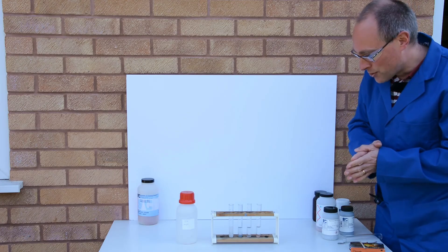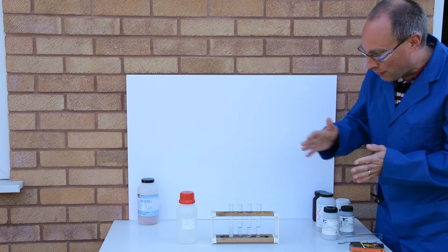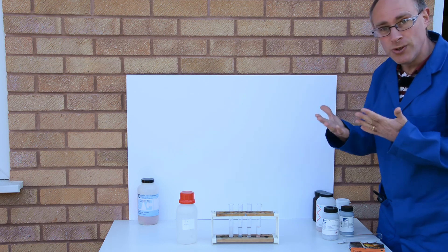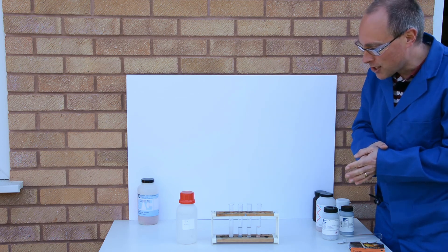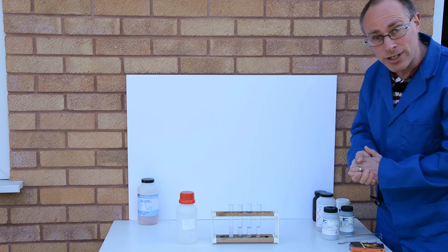And so that's the order of reactivity for these four metals using and comparing their reactions with hydrochloric acid.